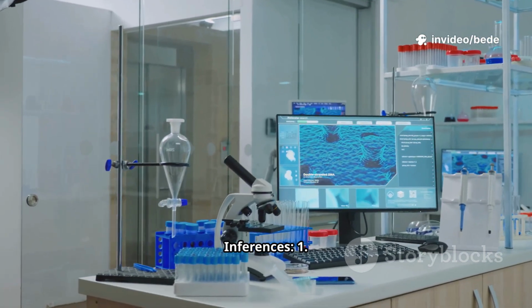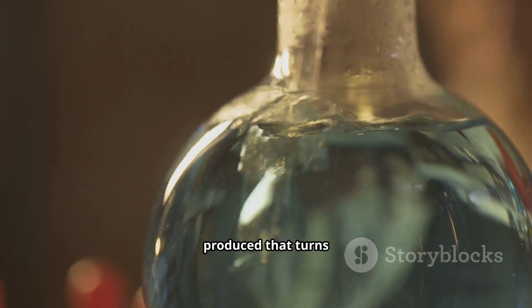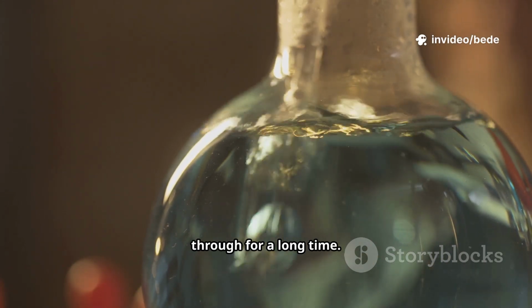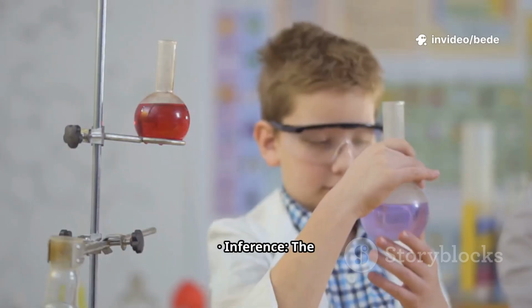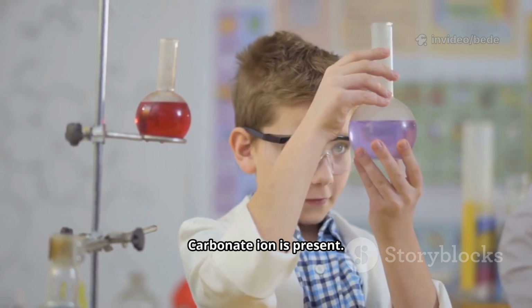Observations and inferences. 1. Observation: a colorless, odorless gas is produced that turns lime water milky. The milkiness disappears if the gas is passed through for a long time. Inference: the gas is carbon dioxide, CO2. This confirms that carbonate ion is present.